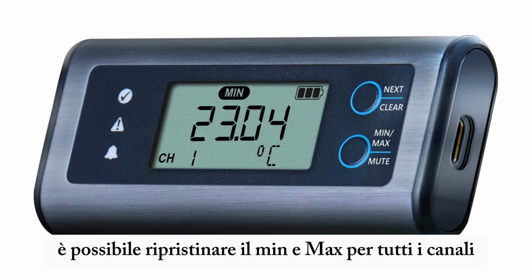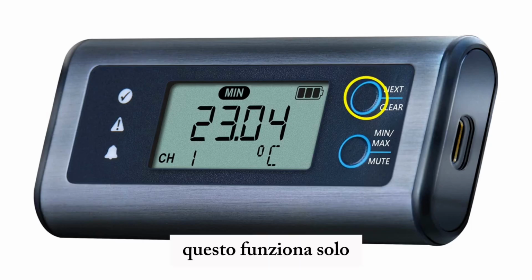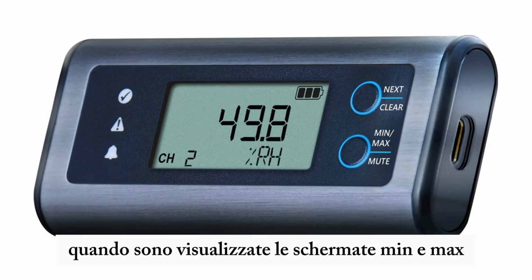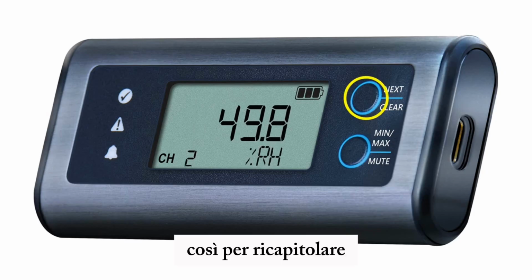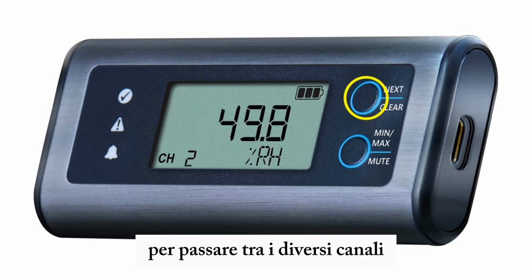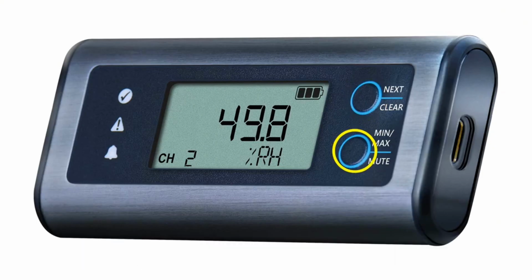You can reset the min and max for all channels together with a long press of the top button. This only works when the min and max screens are on display. So to recap, it's a short press of the top button to go between the different channels and a short press of the bottom button to see the min and max values.